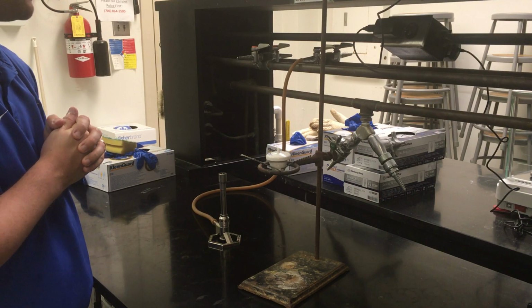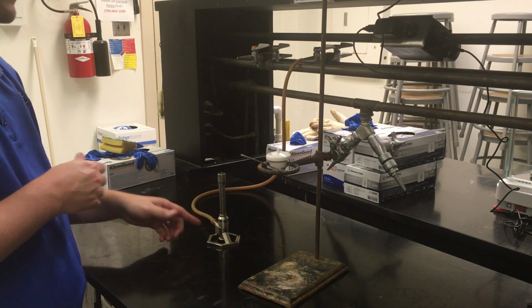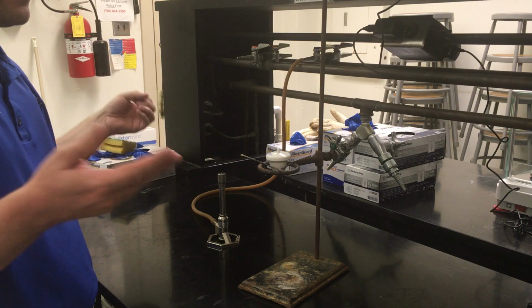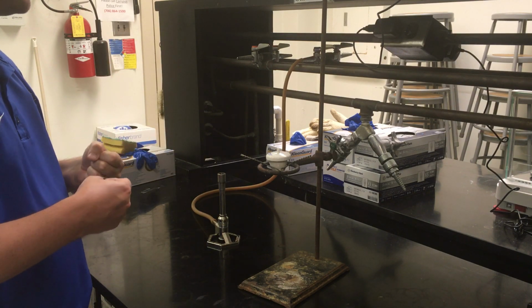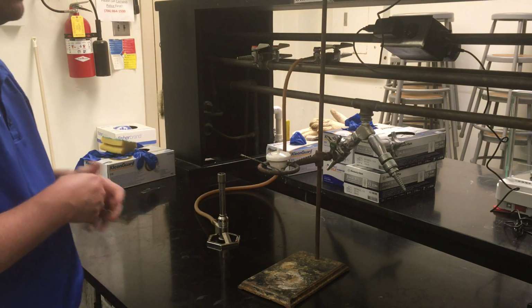I think it's pretty self-explanatory. And don't shut them off at the bottom of these things either. Otherwise, they can still be leaking out gas into the surroundings, and if everyone else is using open flames around you, that's a potential problem. So just always make sure to shut the Bunsen burners off at their valve up here.